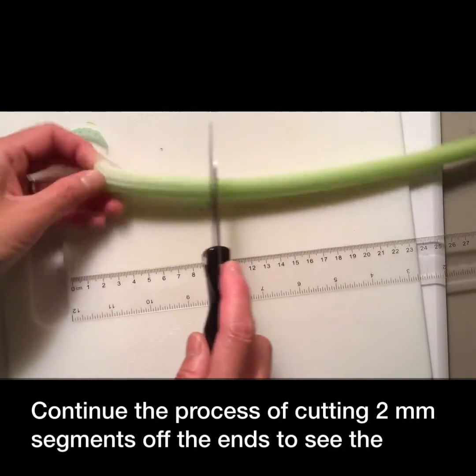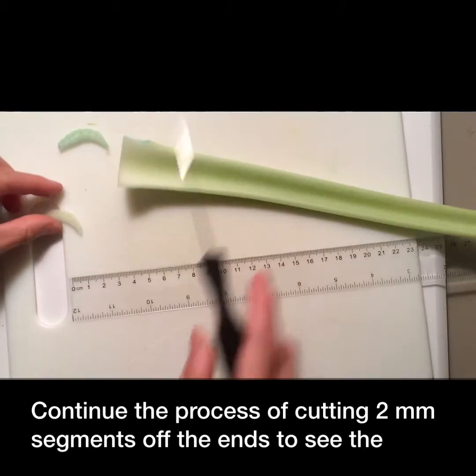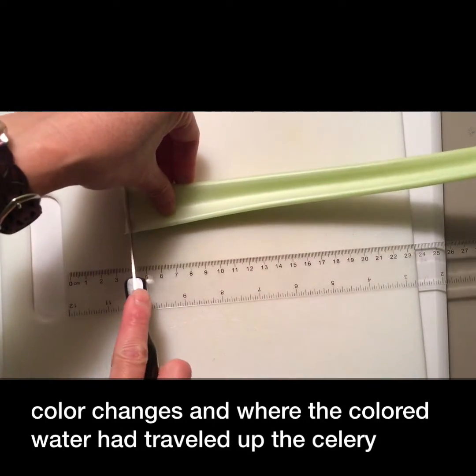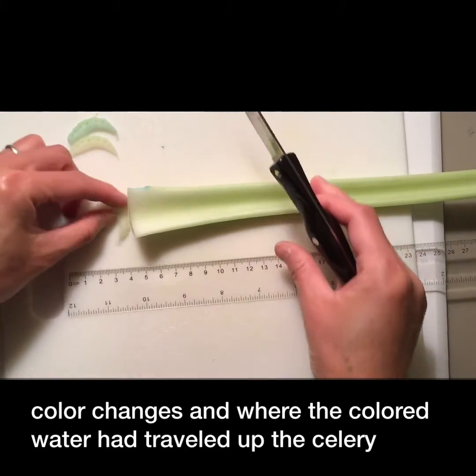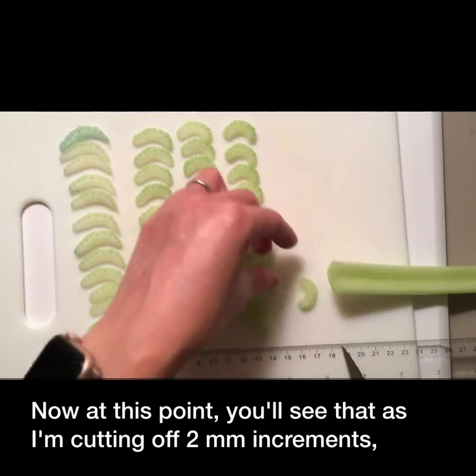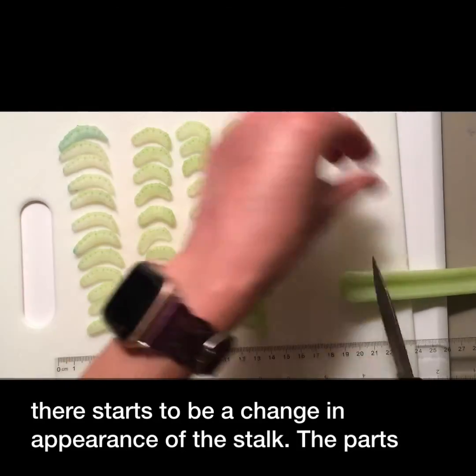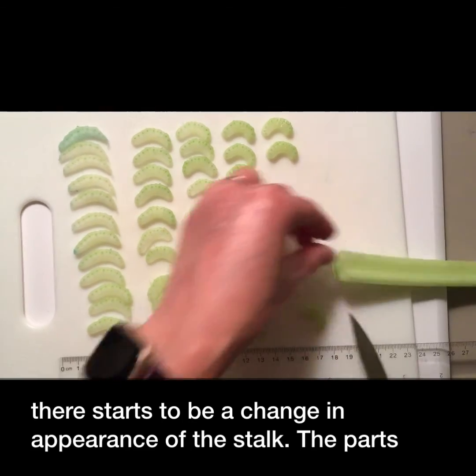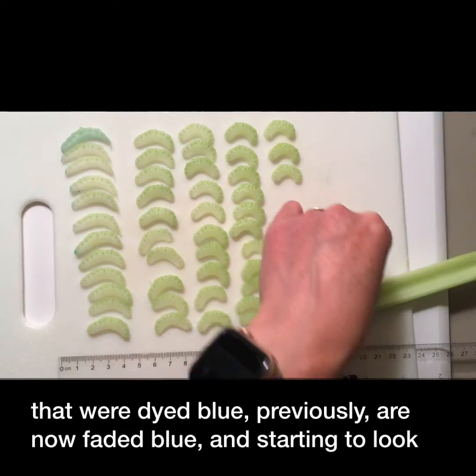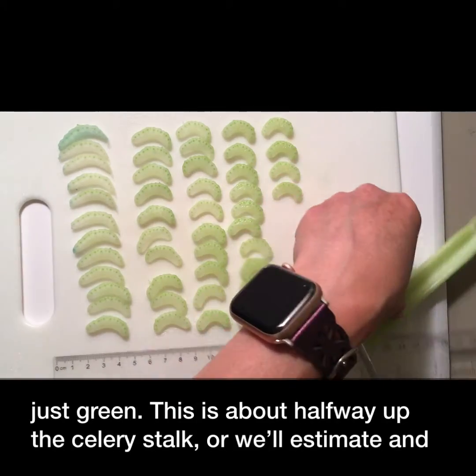Continue the process of cutting two millimeter segments off the ends to see the color changes and where the colored water had traveled up the celery stalk. As you cut off two millimeter increments, there starts to be a change in appearance of the stalk — the parts that were dyed blue previously are now faded blue and starting to look just green.